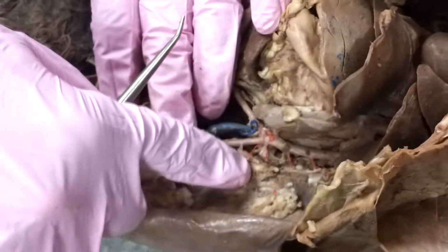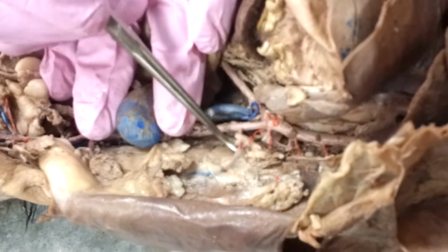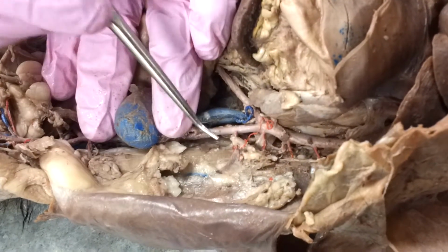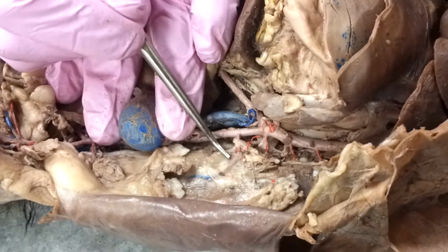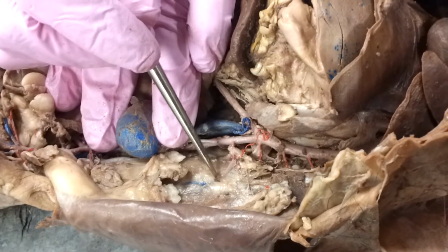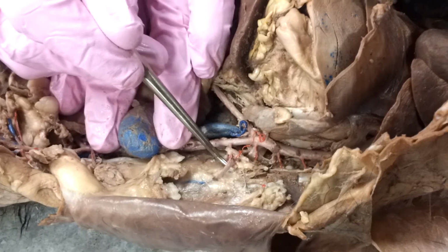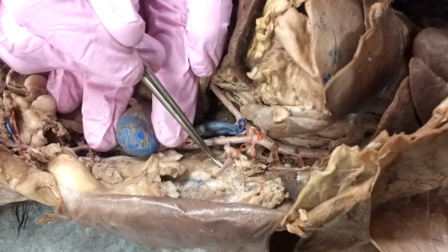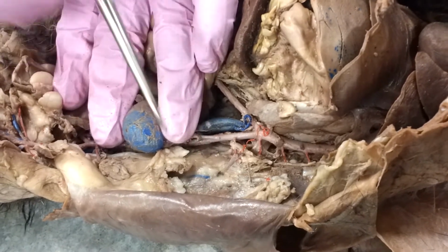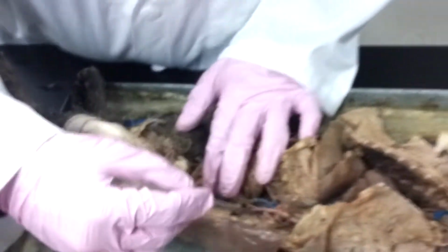Remember, when we're looking for our adrenal glands, we're looking for that hard nodule. And you'll have to take my word for it, but I'm pressing on that adrenal gland. And you can actually see an artery and a vein going right to that hard spot. So we've got our adrenal artery and our adrenal vein right there, and that's going to our adrenal gland. So that's another artery and vein.